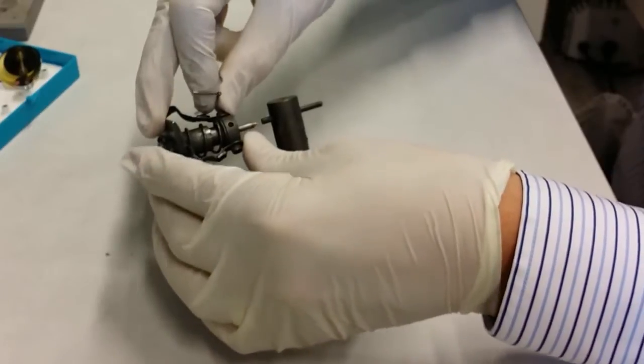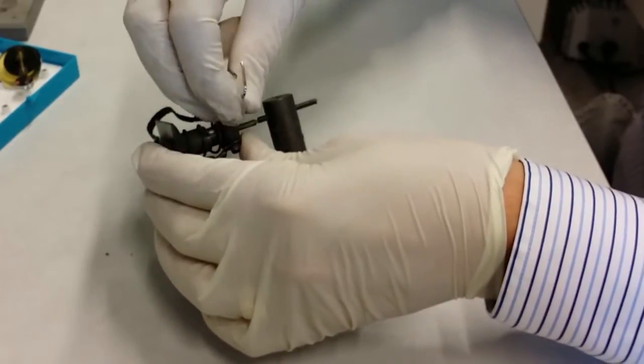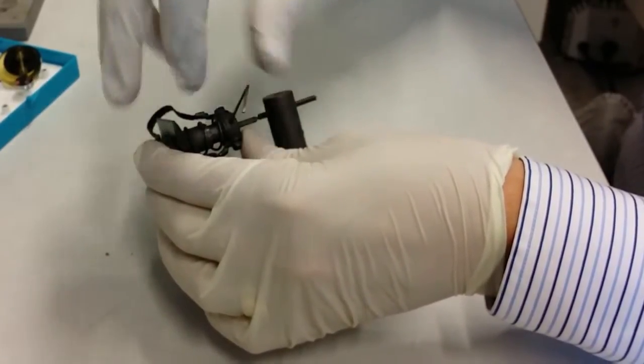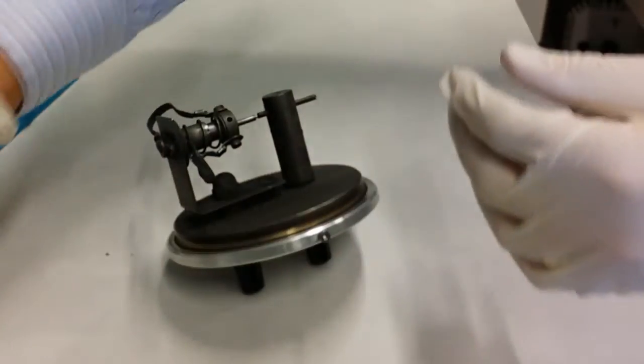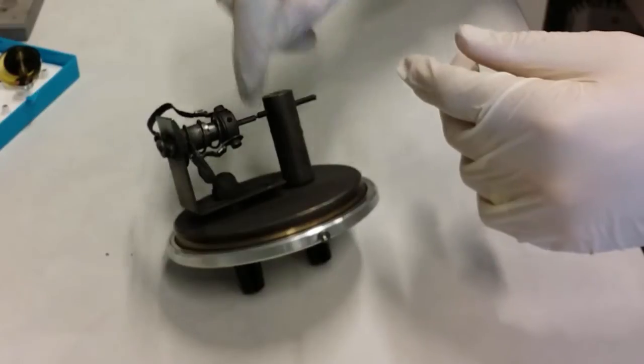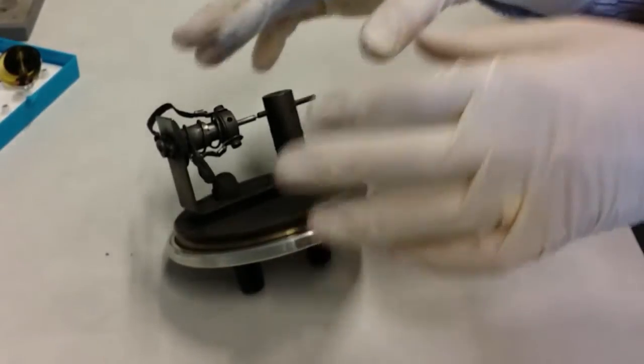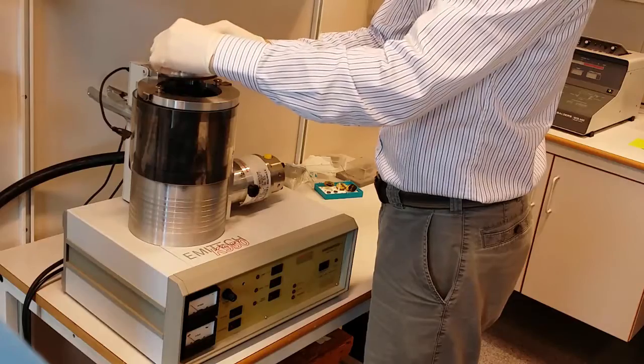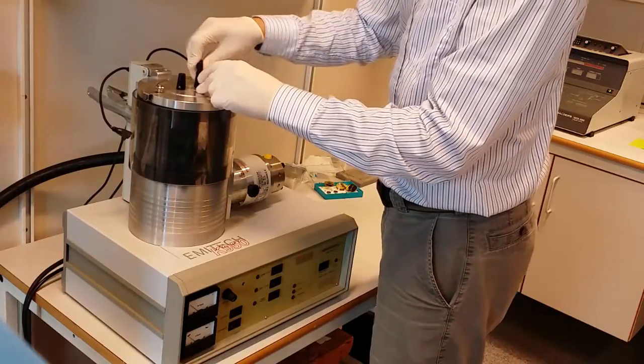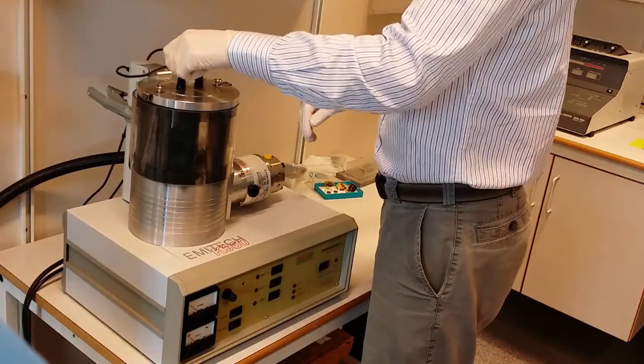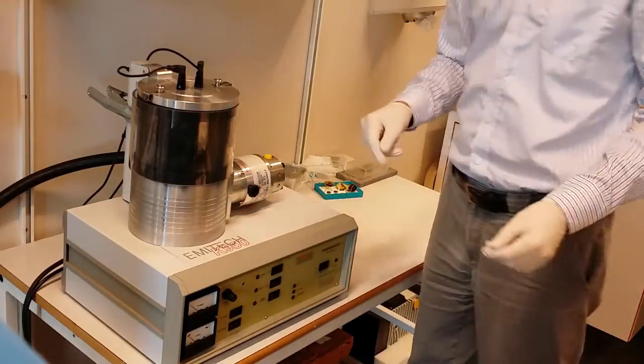We pull back the spring a little, tighten the screw. And now you see it is making contact there. So now everything is set up and can be put inside the chamber and we can run the machine. So connect the electric connectors and then we are going to start up the machine.